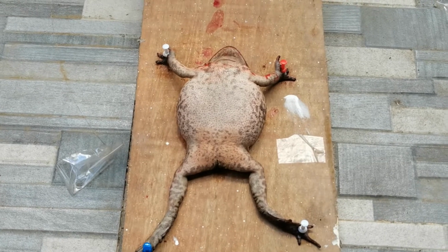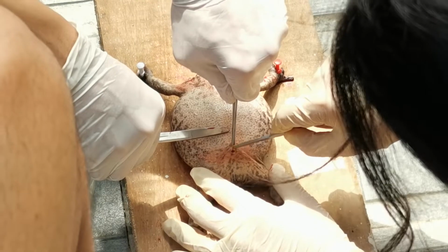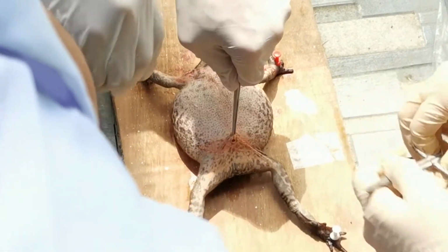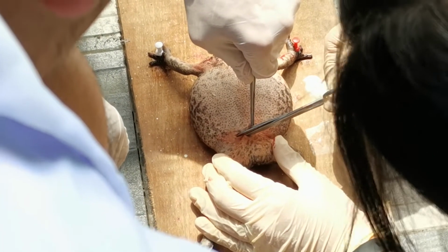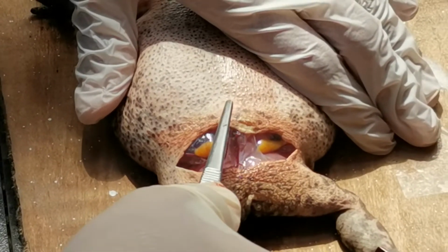Place the frog in a dissection tray, ventral side up, and pin down the forelimbs. Use the forceps and scissors to lift a piece of skin where the hind legs meet the body. Insert the scissors and cut just the skin along the midline to the level of the lower jaw. Clip the skin at a right angle to the incision as shown.